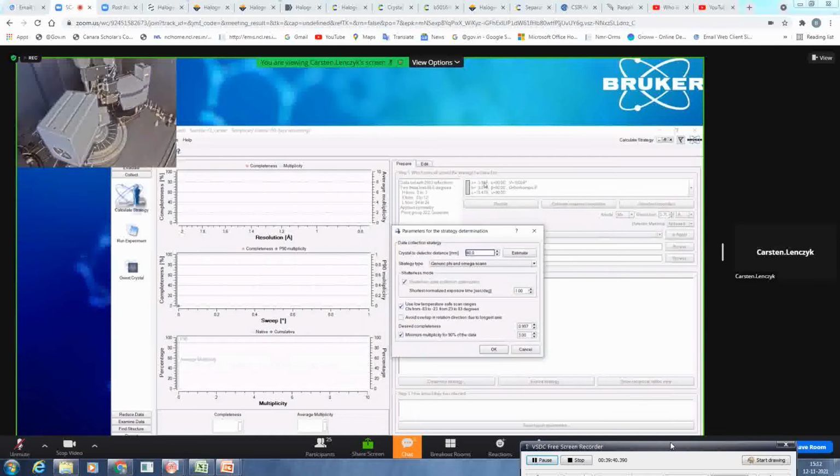And you know that your unit cell is reasonable. I would say it's medium or even a little bit smaller. If you have a huge unit cell, of course, the spots will close up on each other, so you might consider collecting data at longer detector distances. Here, if you have a cryo attached to your system, it will automatically recognize it and by default it will be activated. This function prevents it from calculating a strategy where chi is either perpendicular to the cryo stream or directly in line with it. This is only to not provoke icing on your sample.